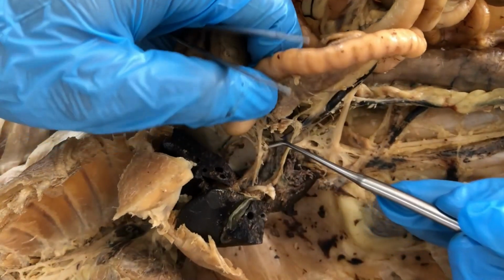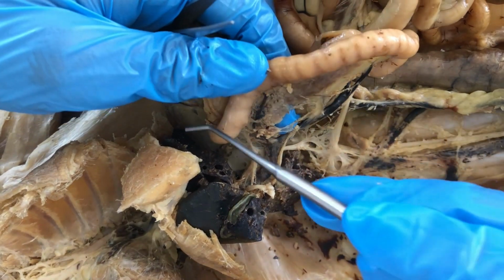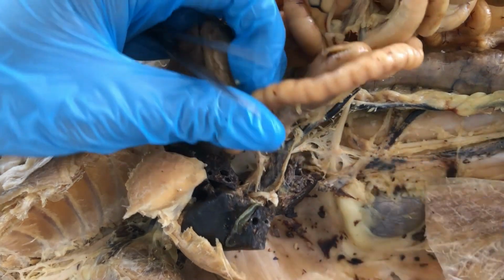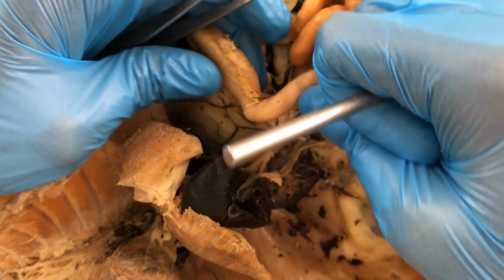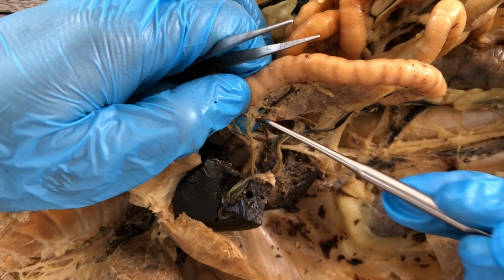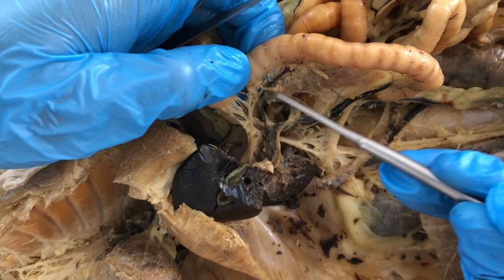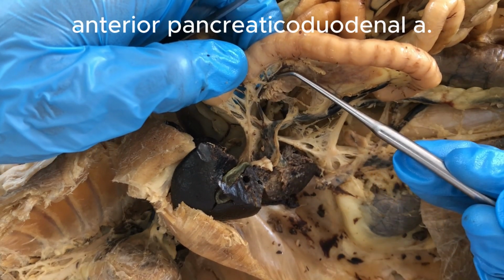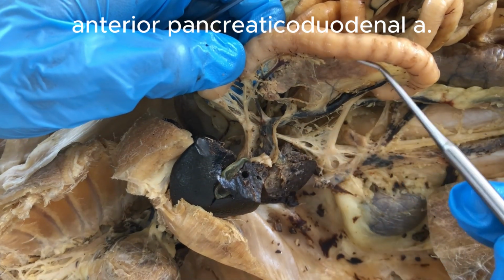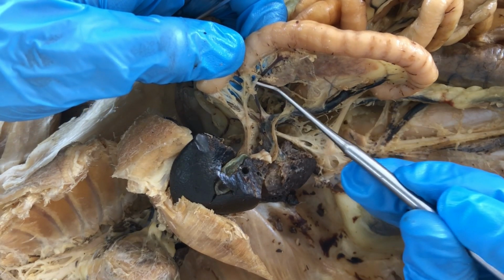And then there's going to be a branch going for the stomach, the pancreas, and the duodenum. That's the gastroduodenal artery. The gastroduodenal artery will give rise to the anterior pancreaticoduodenal artery. You see it goes curved like that, going to the pancreas. That's the anterior pancreaticoduodenal artery.